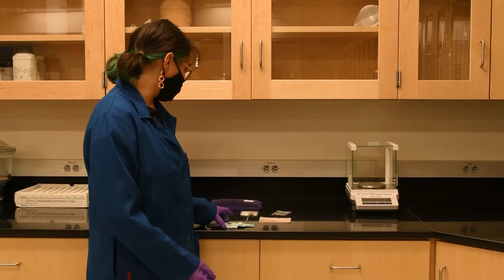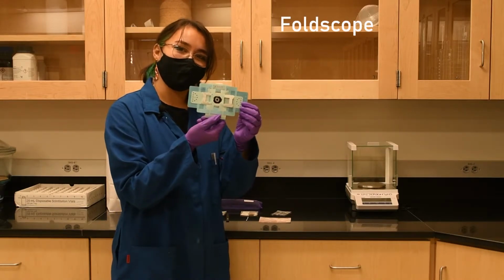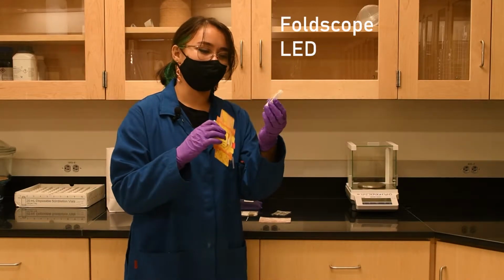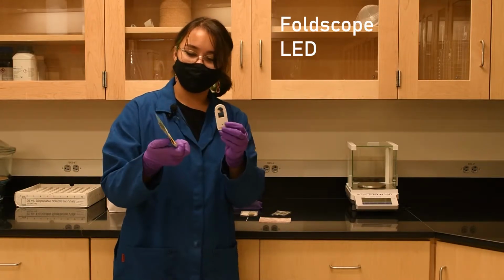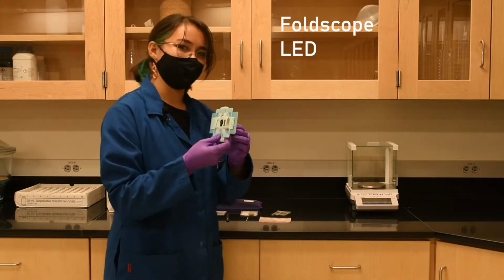In your kit for this experiment, we've included a Foldscope, which will be your own personal microscope for this at-home lab. There is also an LED pack. Please make sure to pull out the back tab on the battery pack to turn it on. And the LED will connect by a magnet to your Foldscope to light up your sample for better visualization.